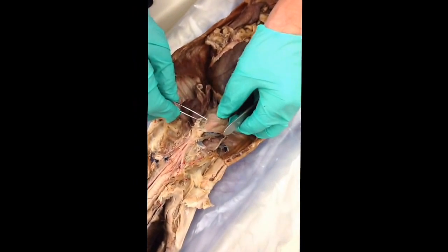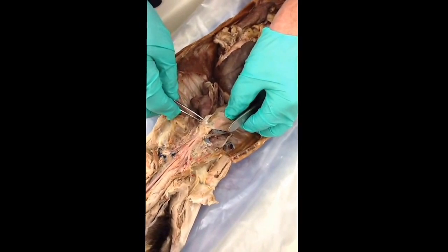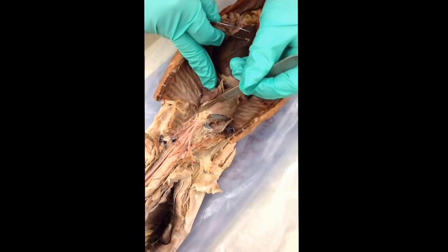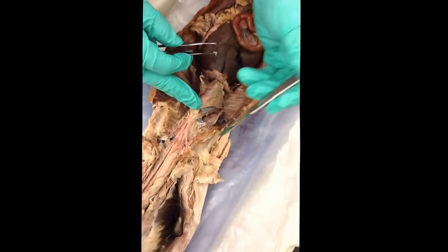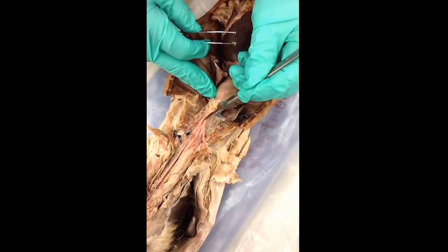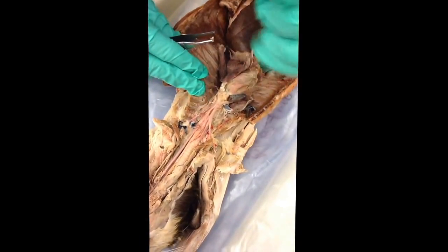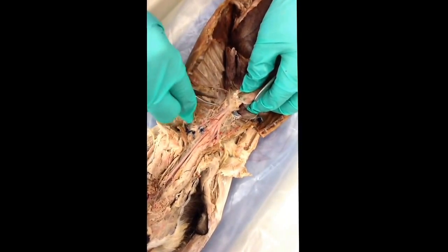Okay, the beef heart, or the cat heart, the main thing to see here is the pulmonary trunk, or pulmonary artery. And the arch here, that is the aorta, comes up and goes around, goes down, forms the descending aorta, which we'll come back to. Branches off of the arch of the aorta would be the brachiocephalic and the left subclavian. Oh man, the left subclavian on this cat is not that good.